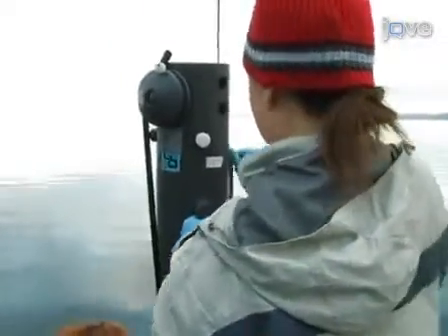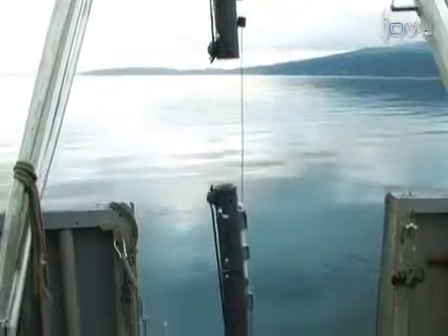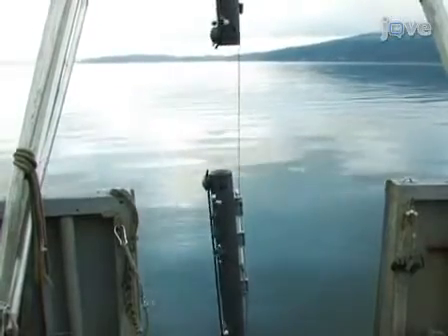Note that for depth intervals where large volume water samples are collected, a total of 2x 12-liter bottles are loaded consecutively, approximately 0.75 meters apart. After all the devices are on the line, lower the line to the deepest depth.